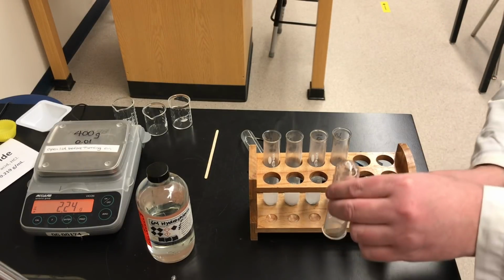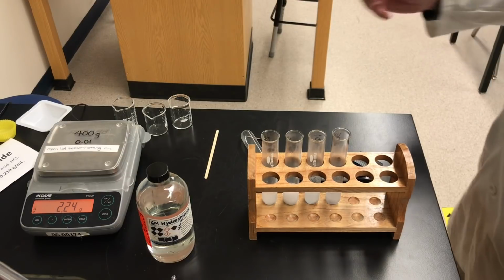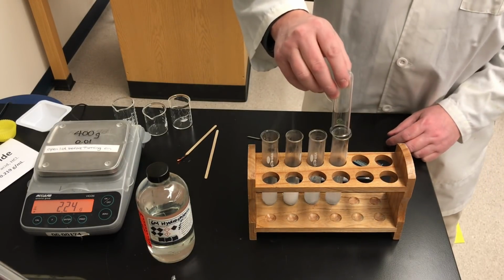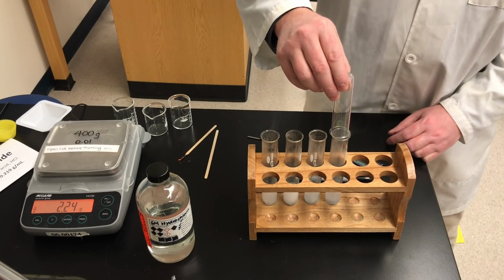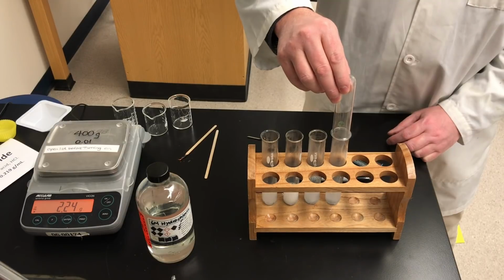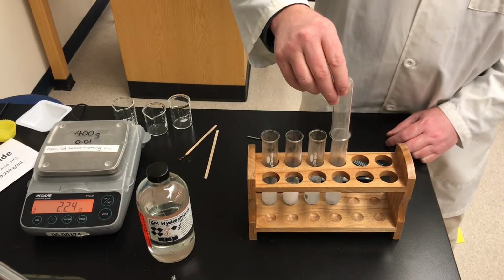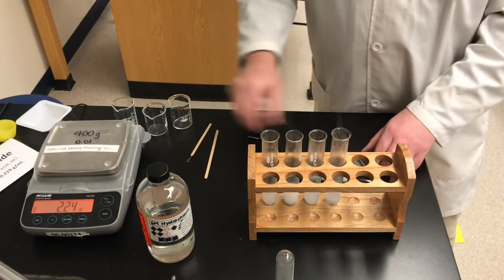So here's the next gas. There we go. So I hope you were able to see that. I wonder if my hand was in the way. So I've got one more. I'm going to do that one more time. All right, so we'll collect that gas one more time, just for about 5 or 10 seconds. All right, so now that I've got the gas, we'll test that one last time.